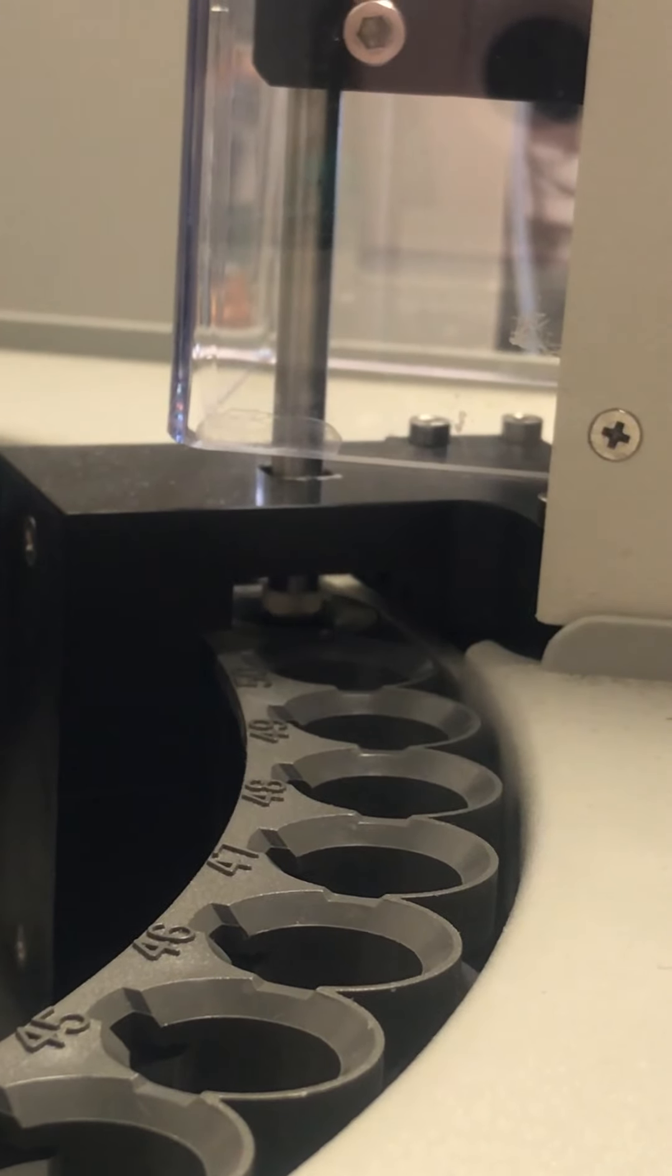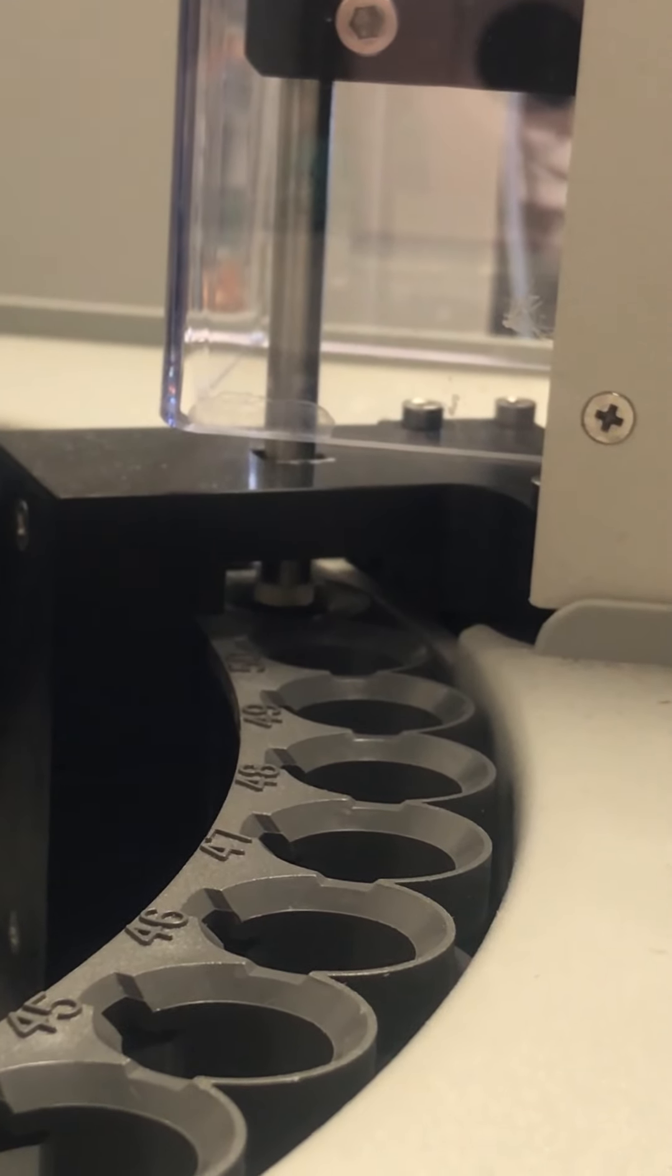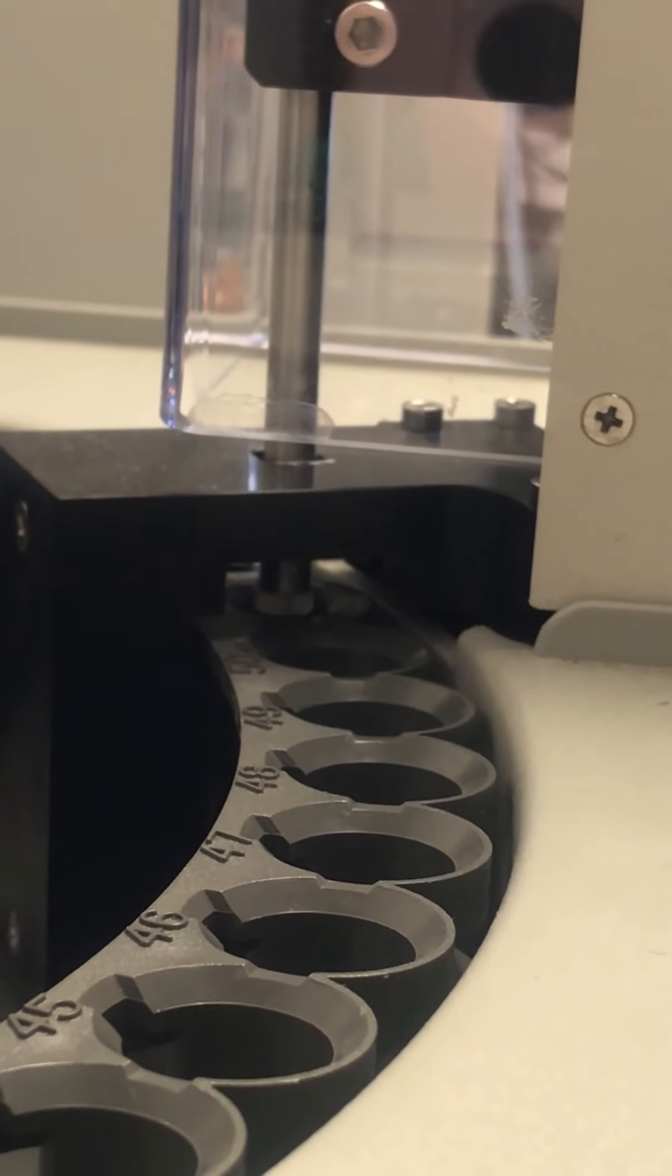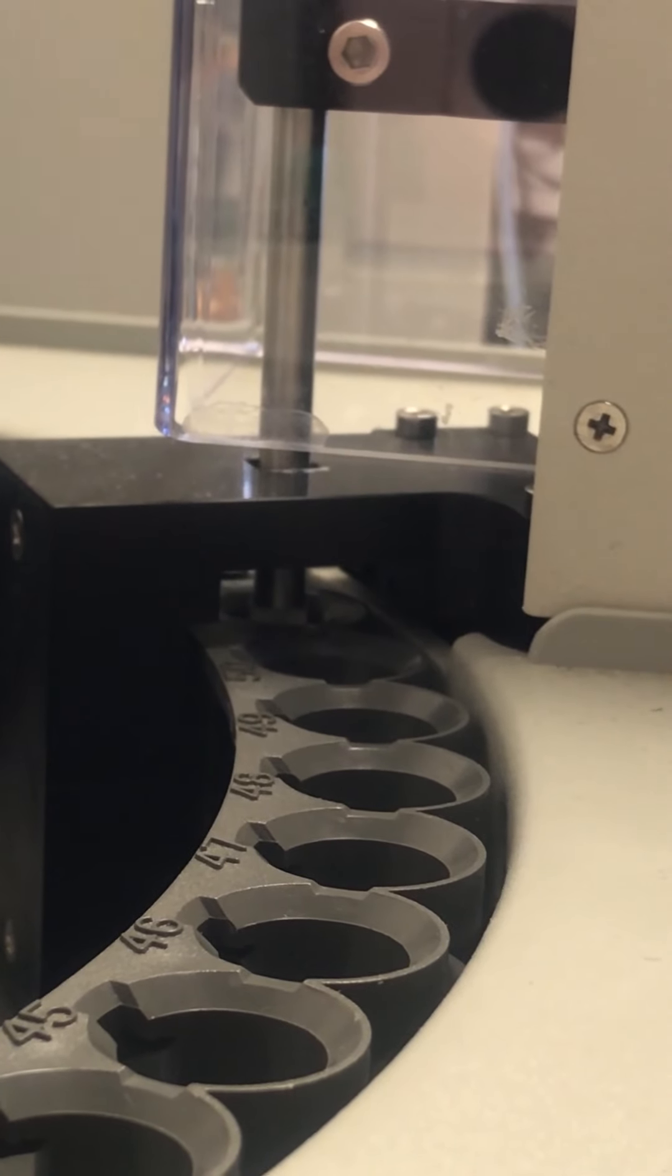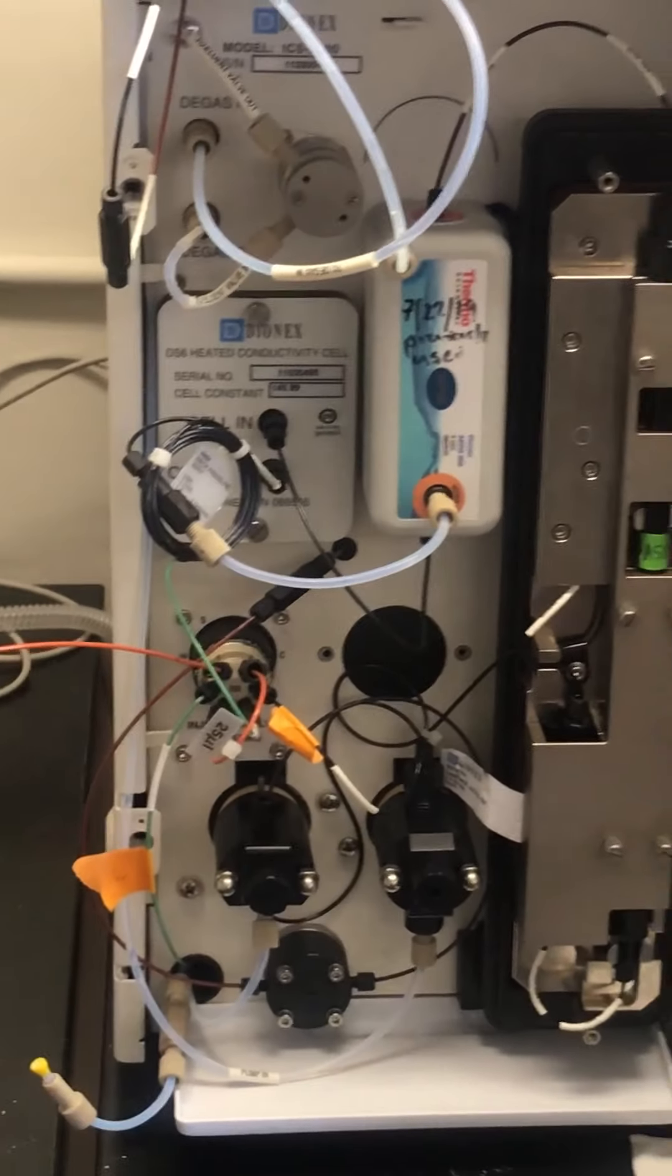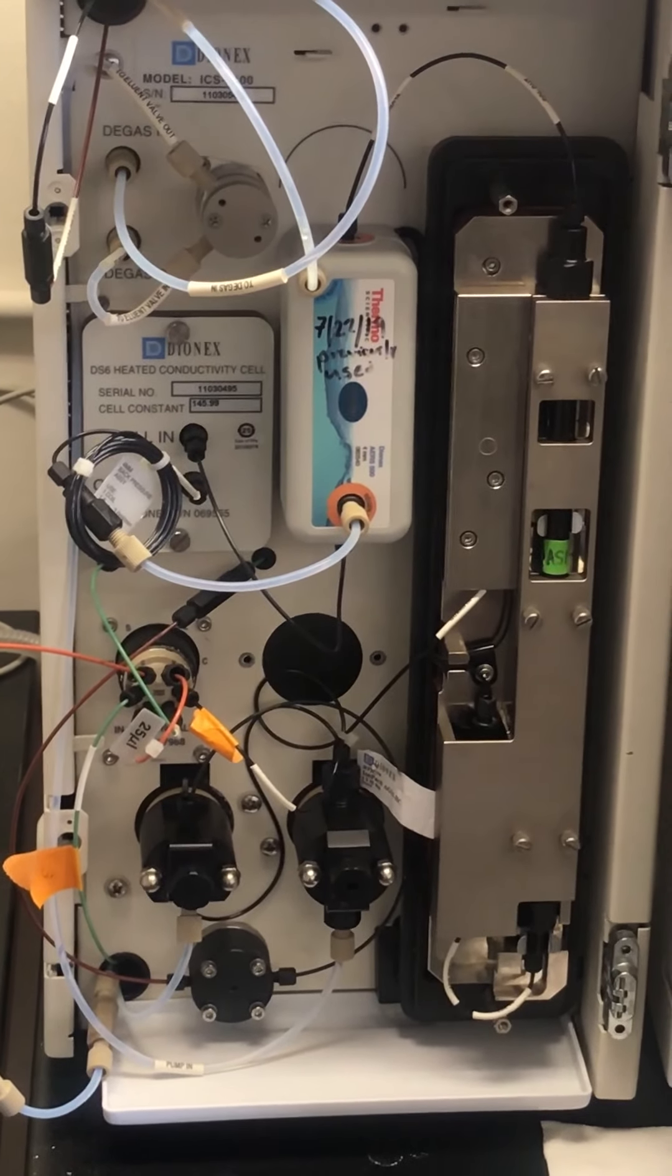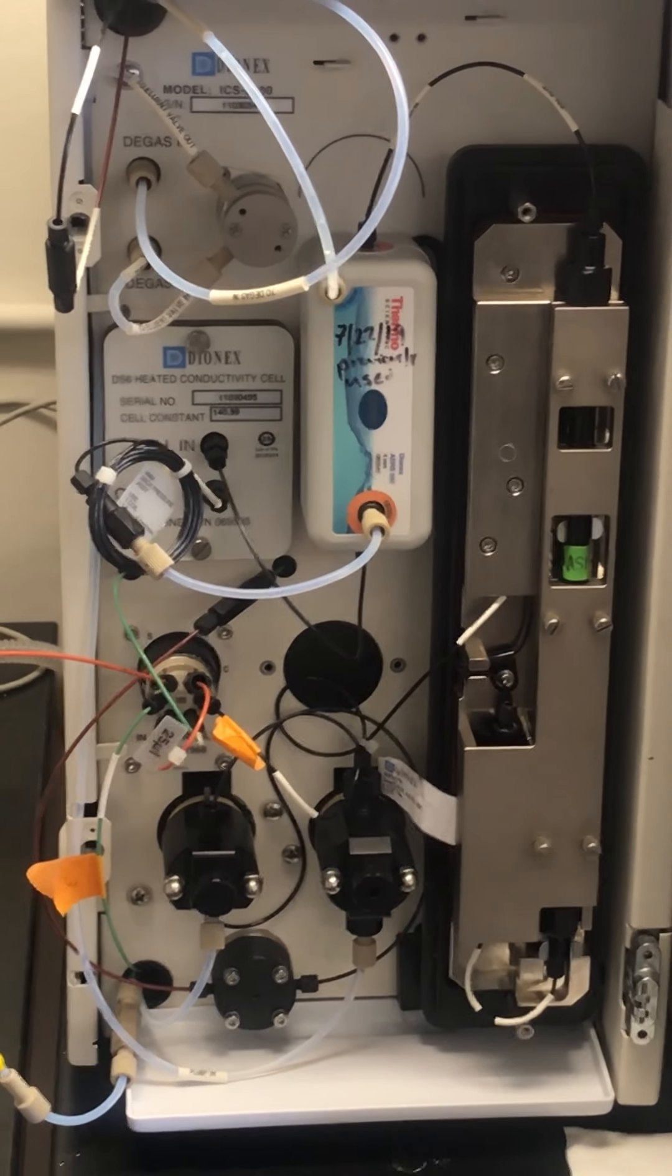As it goes down, it will get into position. It will collect enough water and bring it into this machine here through this tubing, and this is where it will detect the chloride concentration.